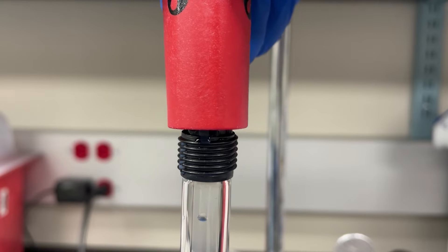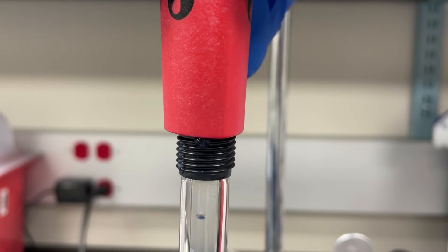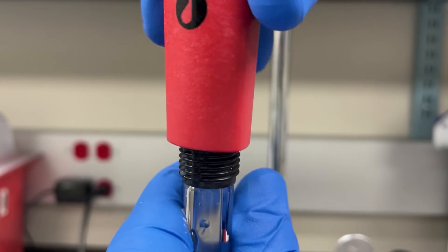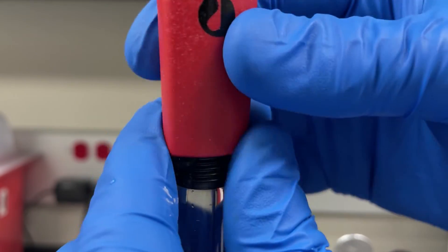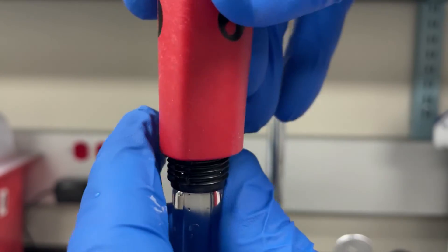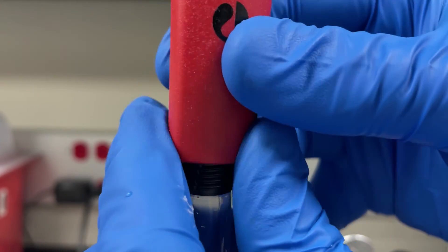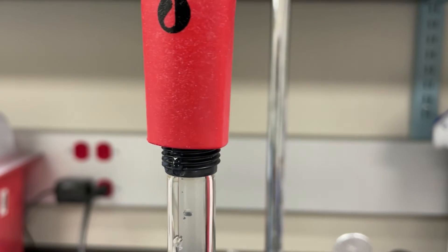There we go. Hold on to it really well. You know you have the adapter properly in the column when it stays perfectly upright. It isn't off to an angle. That looks really good.